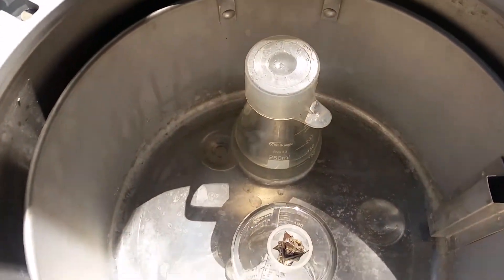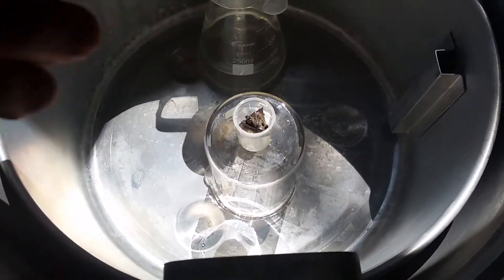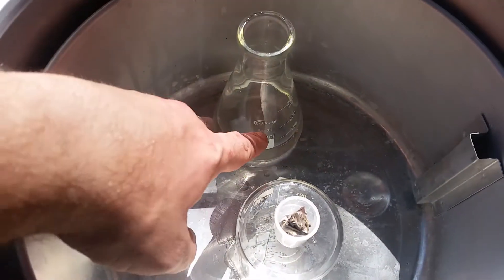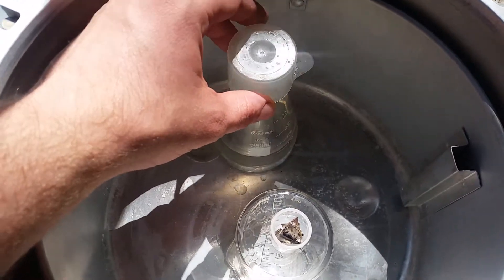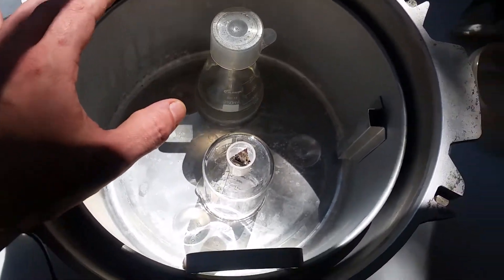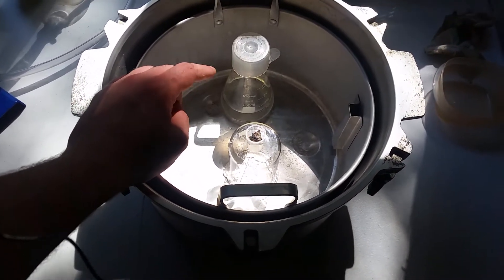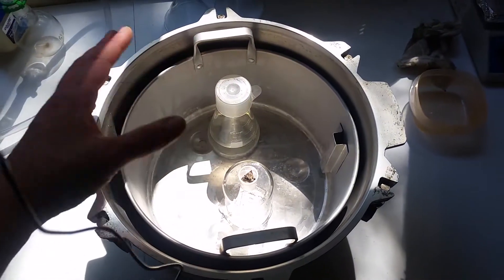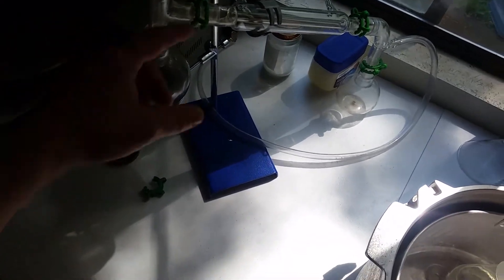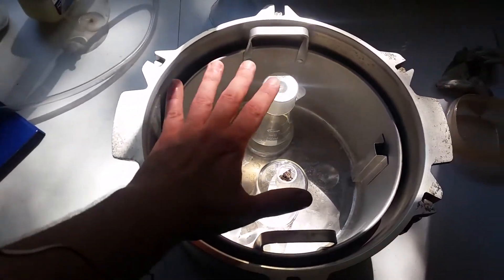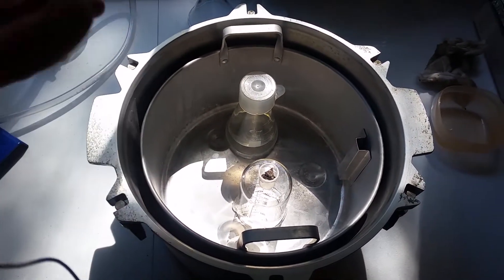So this is the way I'm going to have things arranged inside the autoclave here. I've got the magnets set up right here on top of a beaker just to get them up closer to the top of the autoclave where more hydrogen will be. And then over here is where I'm going to have the sodium hydroxide and aluminum mixture. I just stuck this on top to prevent any extra splashing that might come out. The hydrogen will push it up as it bubbles out. One downside of this method is that I only have one shot to get up to pressure. I'm going to have to get the sodium hydroxide and aluminum reaction going at full pace essentially to get this filled up and to pressure, which means it's going to bubble and spit. I'm only going to have one shot this go around. Because as soon as I crack it, it's going to lose pressure.